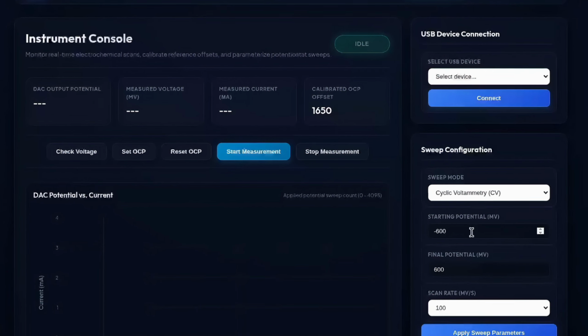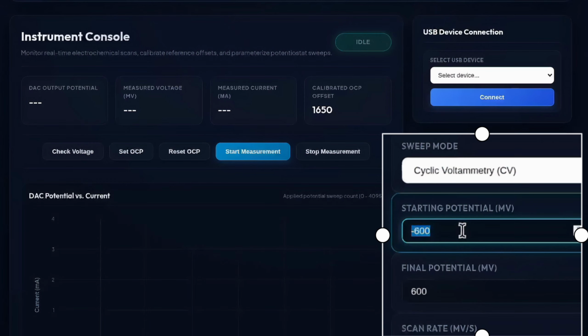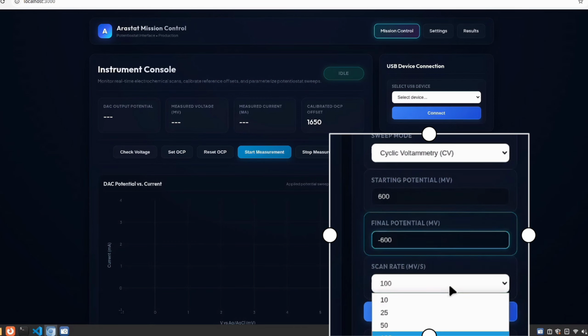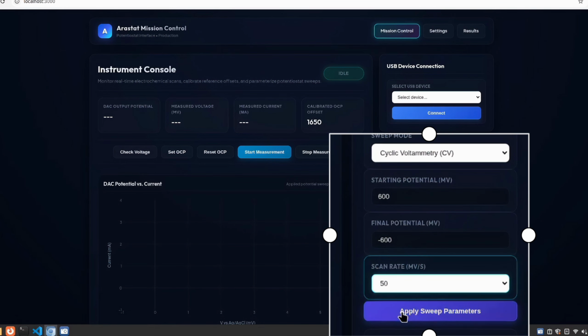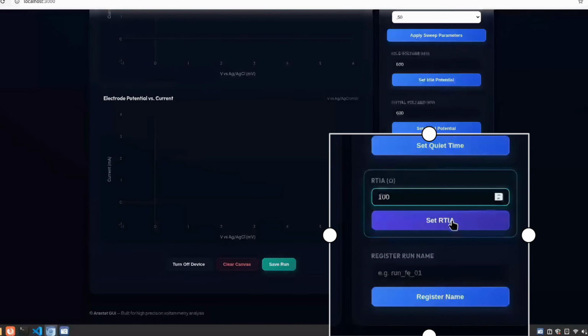Now, we are setting up the parameters for the measurement. We are performing cyclic voltammetry for ferricyanide. Enter the input and click apply, and the command is sent to the microcontroller. It's way easier, right? Now, we do similar things for the other parameters.